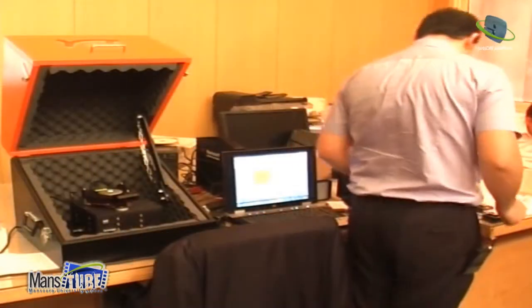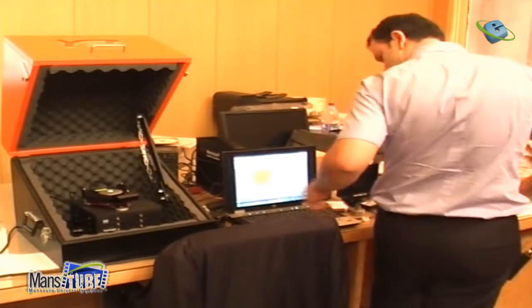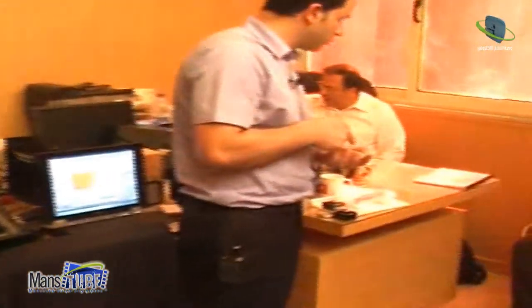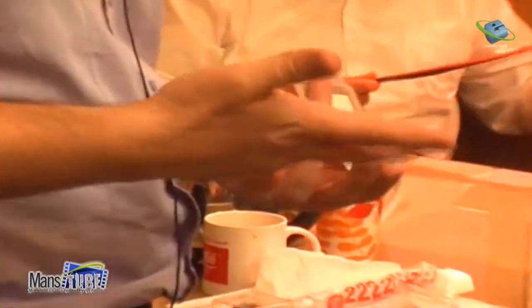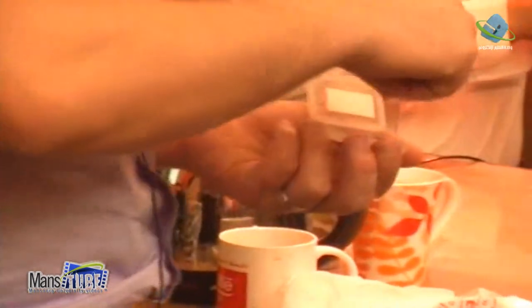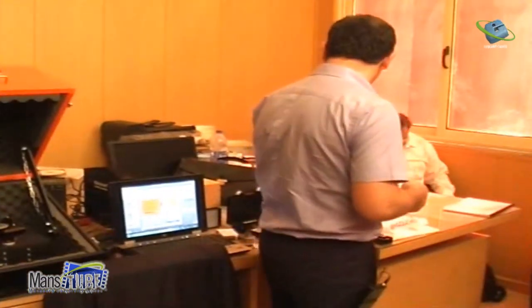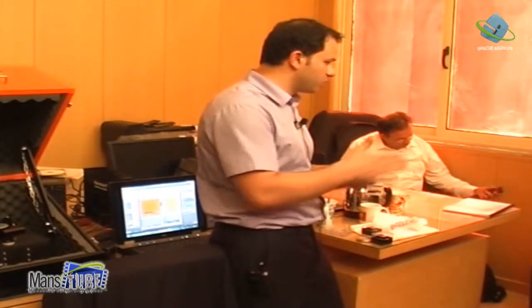What we will do now, I will take a standard sample. I can measure any kind of sample. Let's say we can use graphite, or we use mica. This is usually the standard sample we use in liquid. If you want to measure particles in liquid or something, we drop this material. This sample has the specificity that we can remove a plane very easily. I don't know if you know.